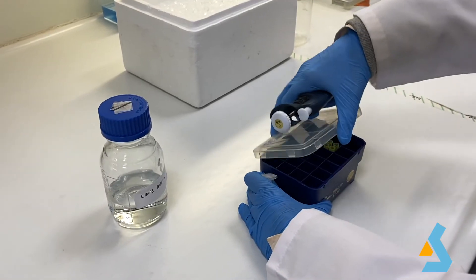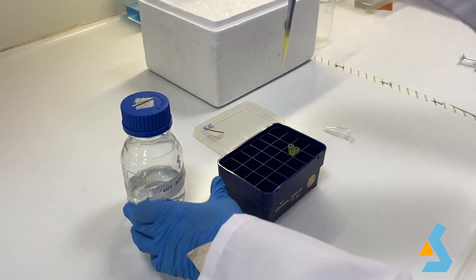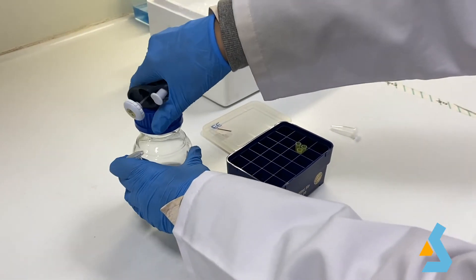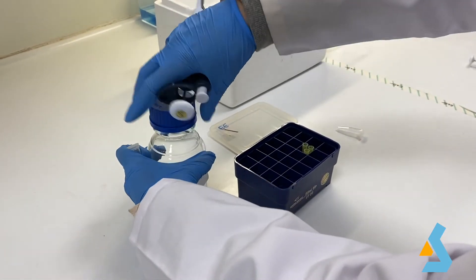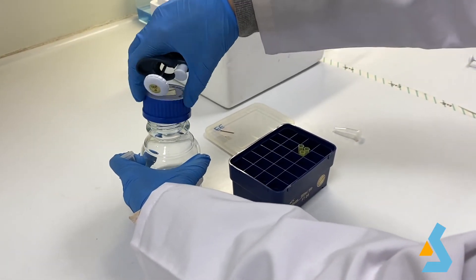Now, for lysis to take place, we re-suspend the pellet with 40 microliters of CHAPS buffer and then incubate it on ice for 30 minutes.